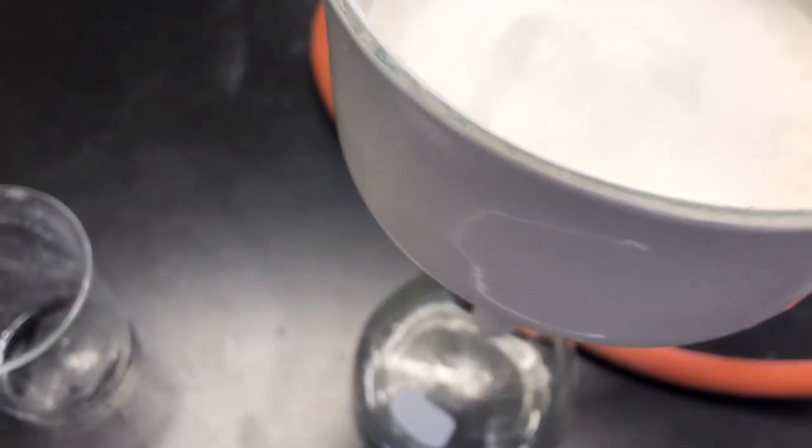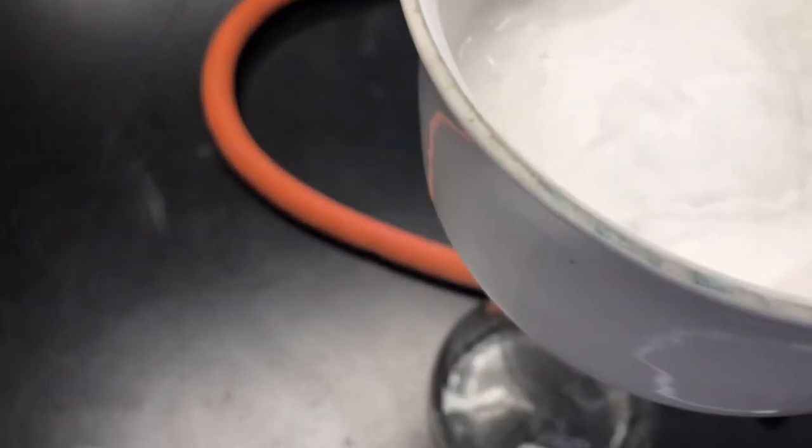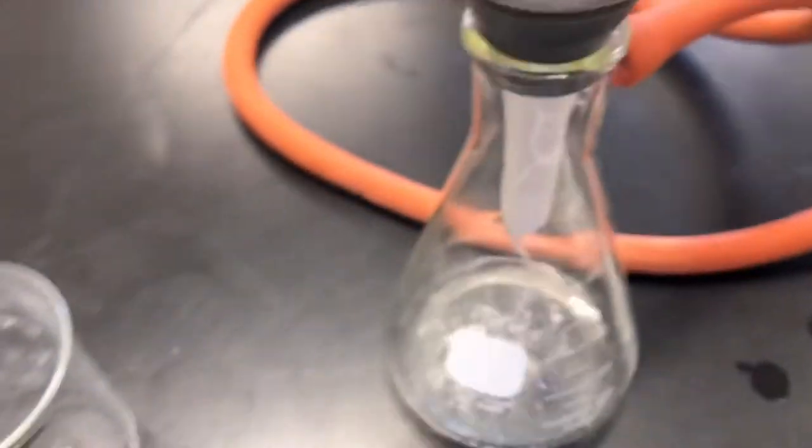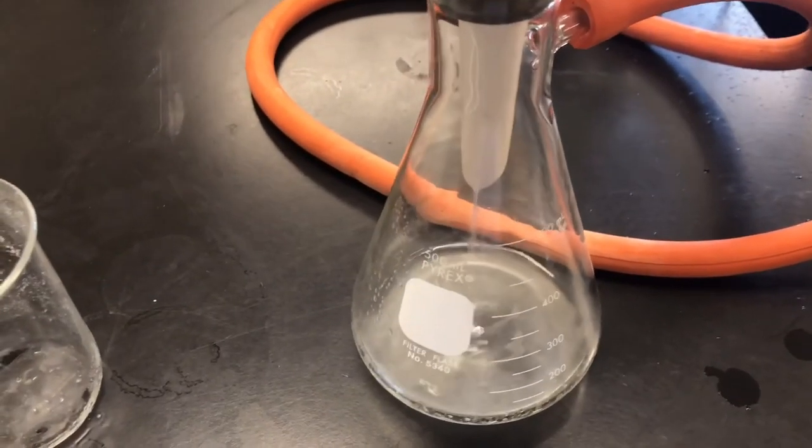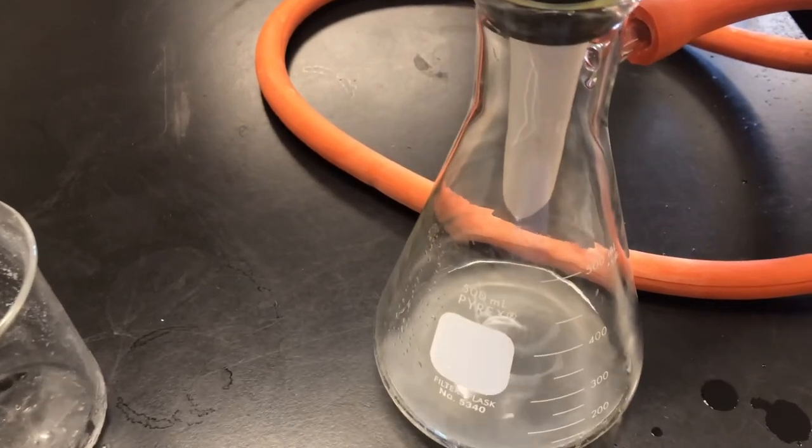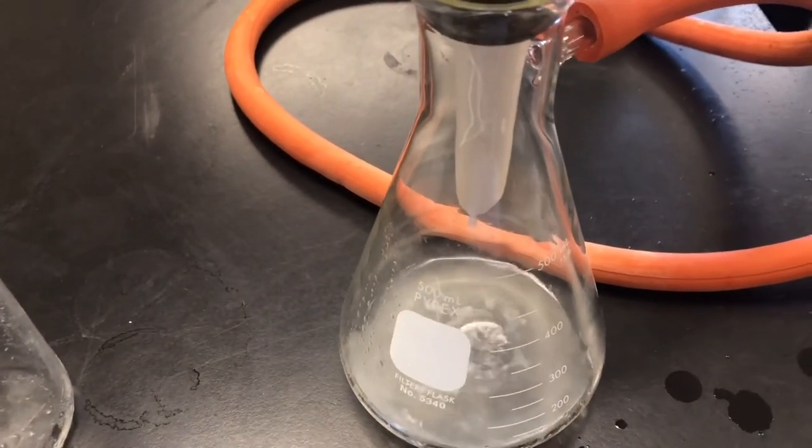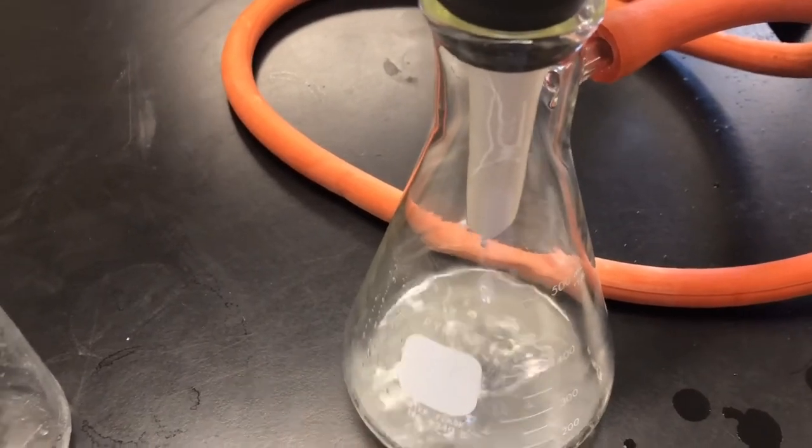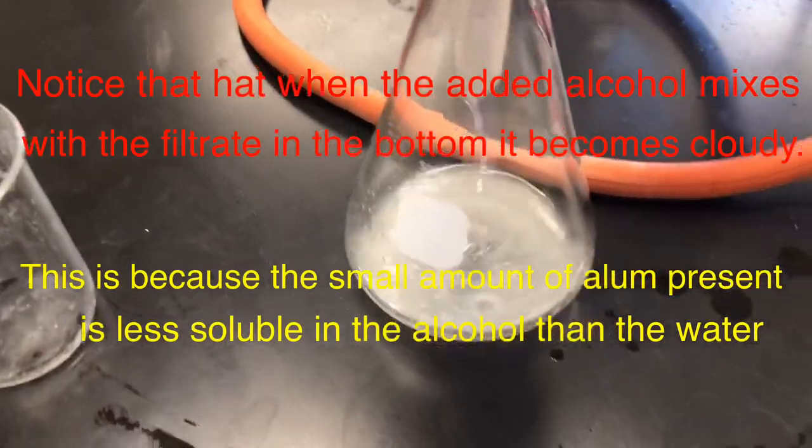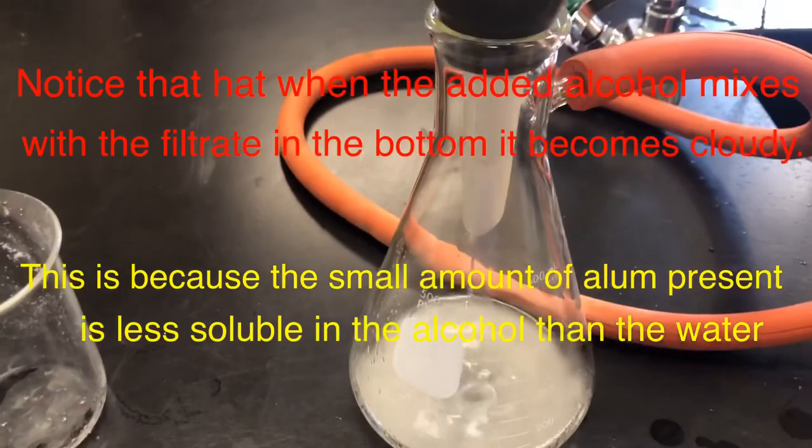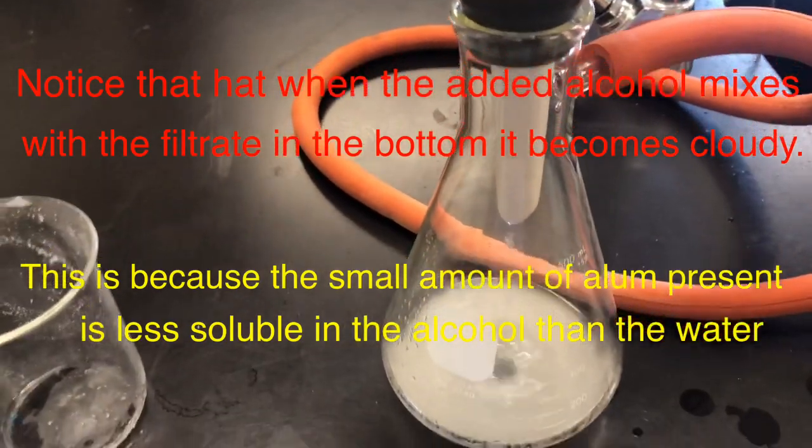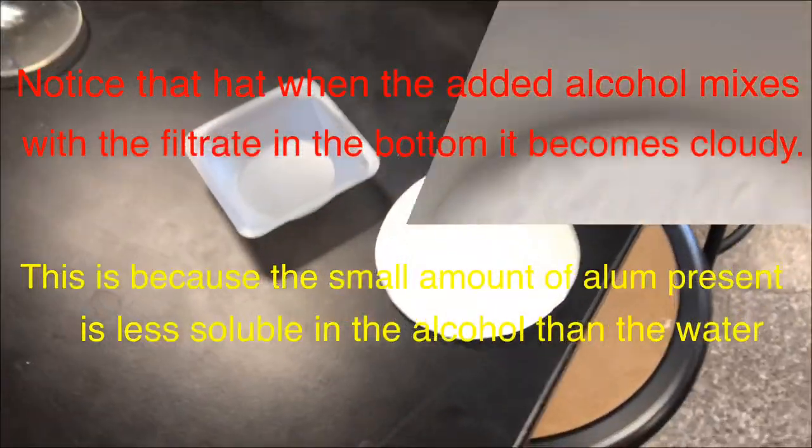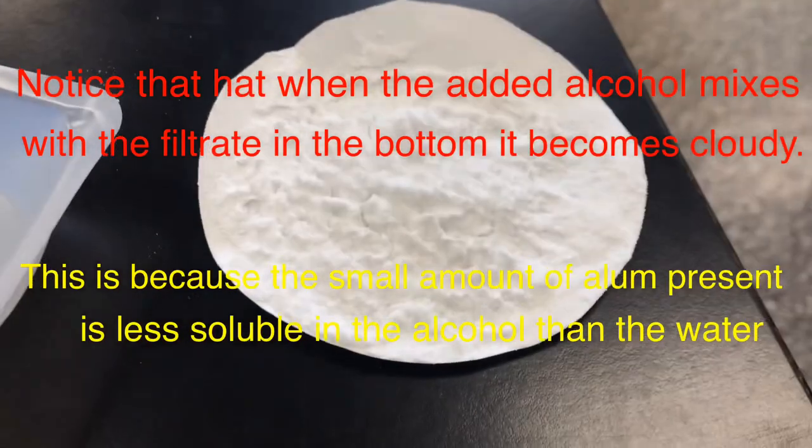This air being pulled through here, it's drying the material. If we add a little bit of alcohol in here, you heard the vacuum kick in. But this is a lot faster than gravity filtration. So here we have our material, it has dried thoroughly.